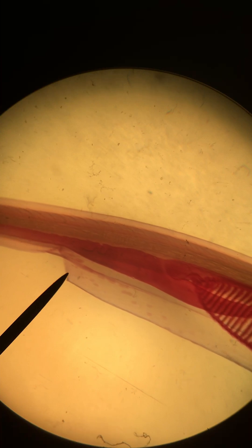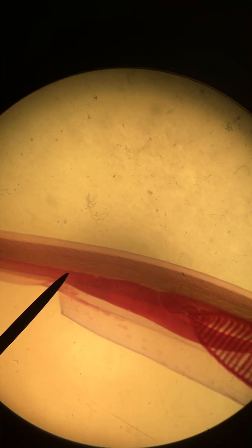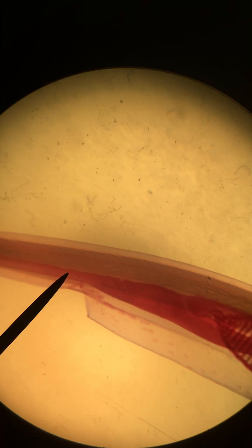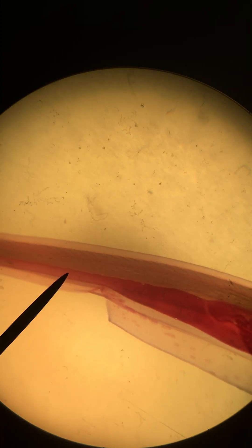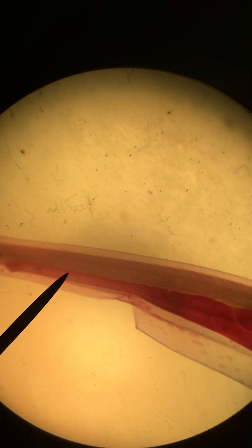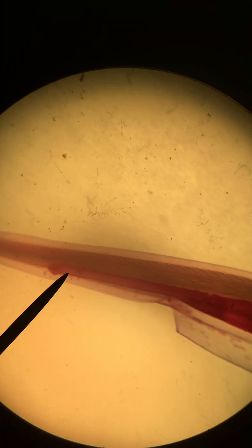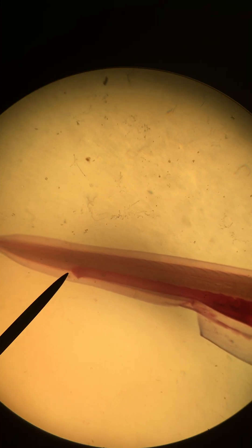Just behind these structures, the intestine will continue, which of course has a role in digestion for the organism. It continues towards the tail and terminates at the anus right here.